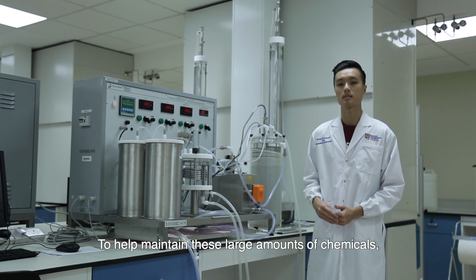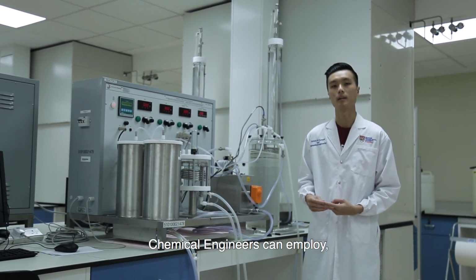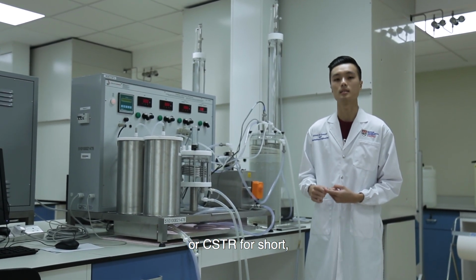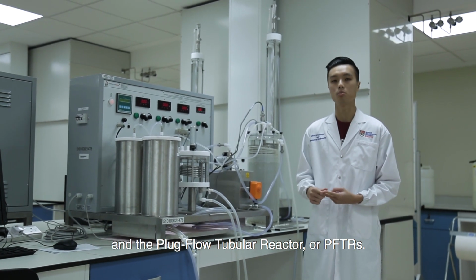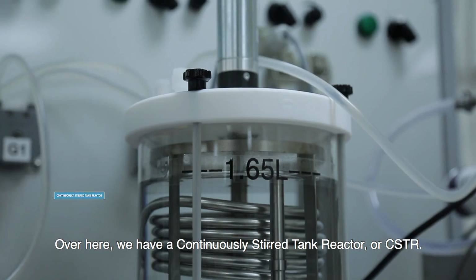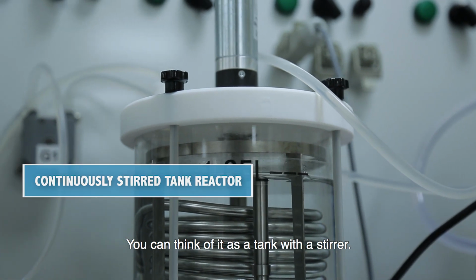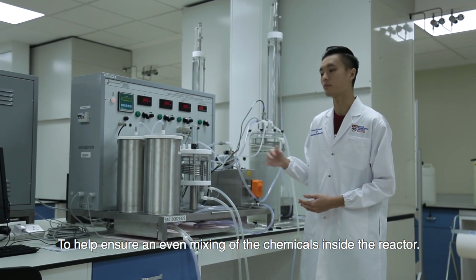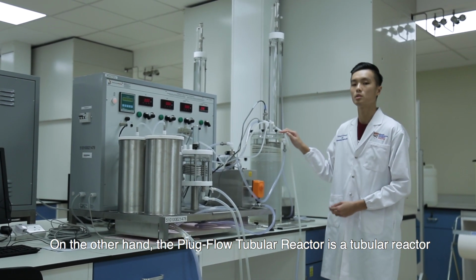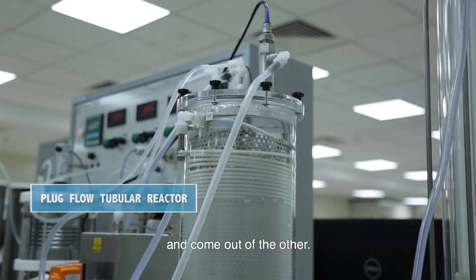To help maintain this large amount of chemicals, there are two common types of continuous reactors that chemical engineers can employ, namely the continuously stirred tank reactors, or CSTR for short, and the plug flow tubular reactor, or PFTRs. Over here, we have a continuously stirred tank reactor, or CSTR. You can think of it as a tank with a stirrer to help ensure an even mixing of the chemicals inside the reactor. On the other hand, the plug flow tubular reactor is a tubular reactor where the chemicals enter from one end and come out of the other.